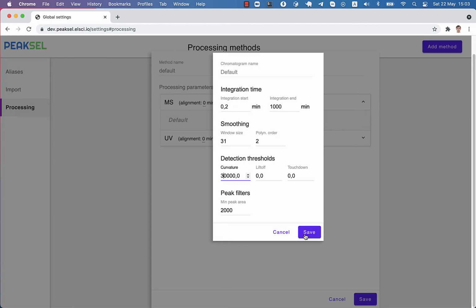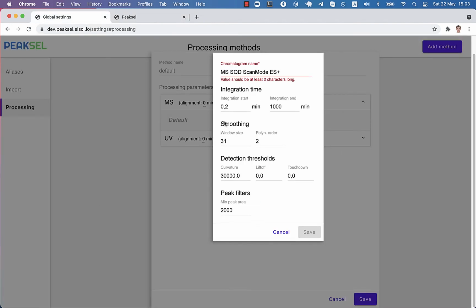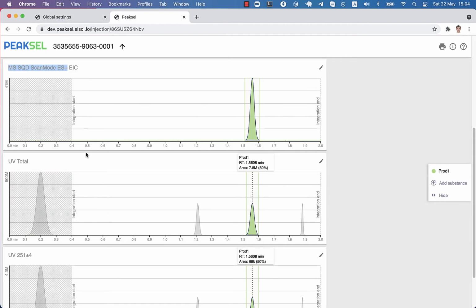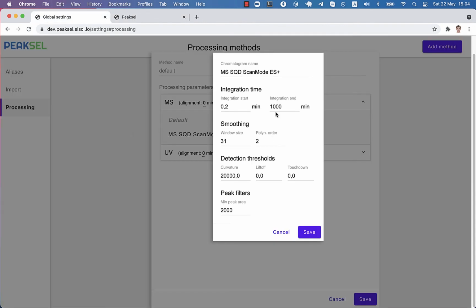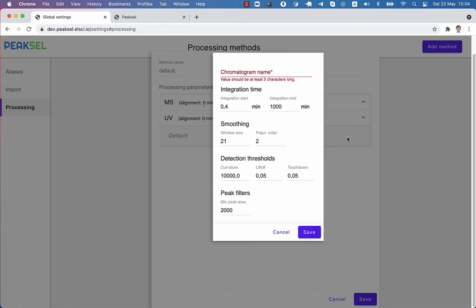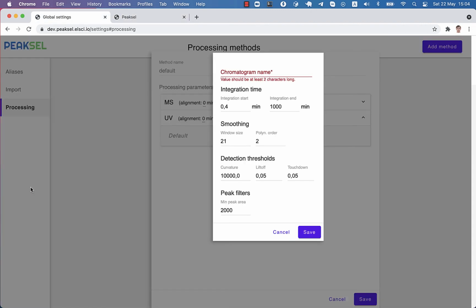Notice that we can change the granularity at which we set up the integration parameters. We could specify it, for instance, for MS chromatograms. Or we could add another template specifically for, let's say, total ion chromatogram. When Peaksel integrates chromatograms, it finds the method that has the biggest common name between these two. We can go ahead and fill integration parameters for other detectors, let's say UV, and eventually set up all necessary configuration for any type of signal.